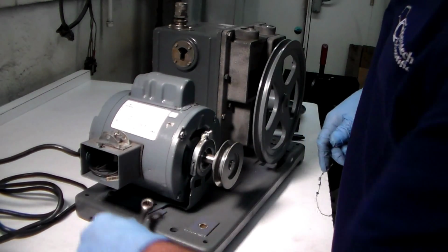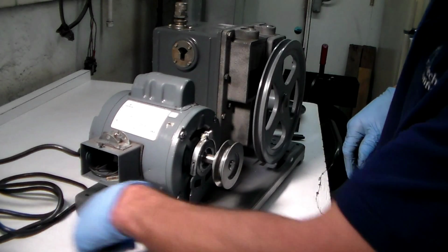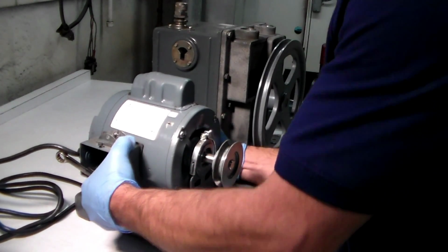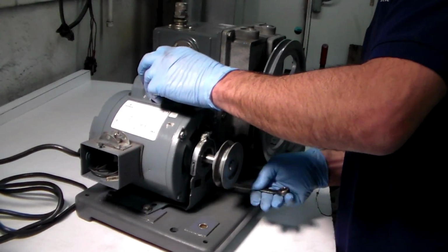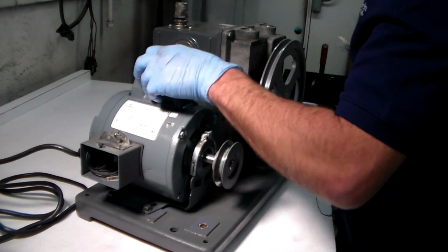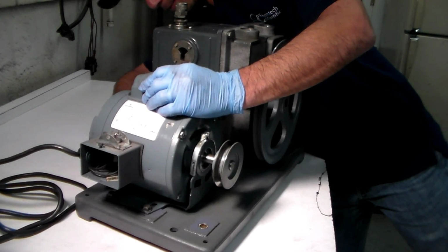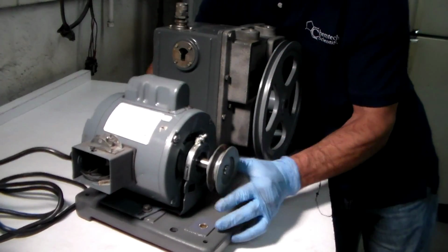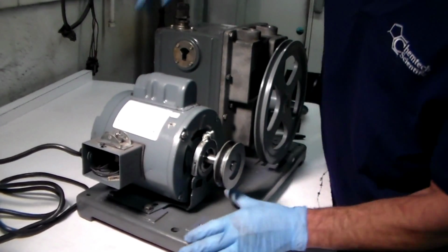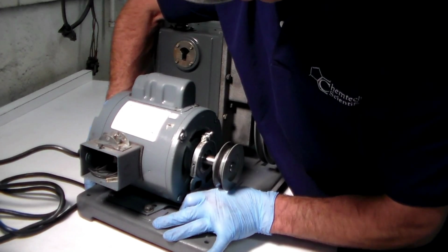And I bring the motor back. Just make sure you loosen these up pretty good, because if you don't loosen them up too good, it kind of jams up on you, like this one did. But it's no big issue. All you do is you loosen up your 4 screws that are holding the motor in place until you have play where you can move the motor back and forth. And you move it to the mark where you marked with the magic marker, okay?